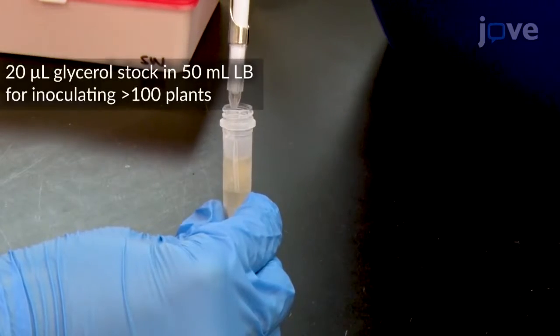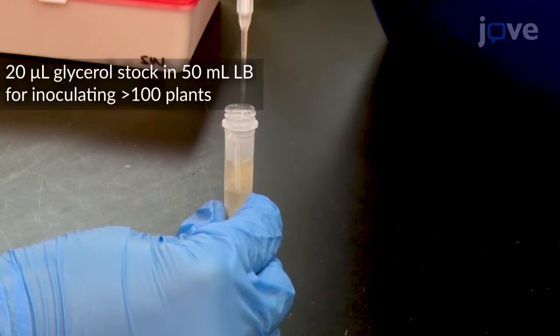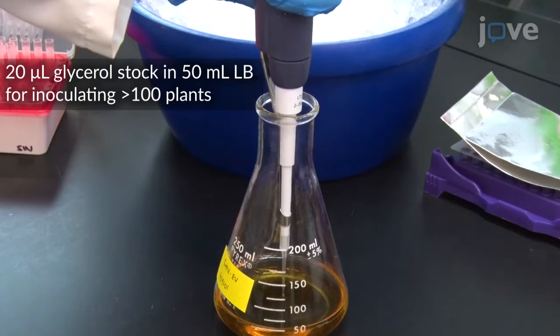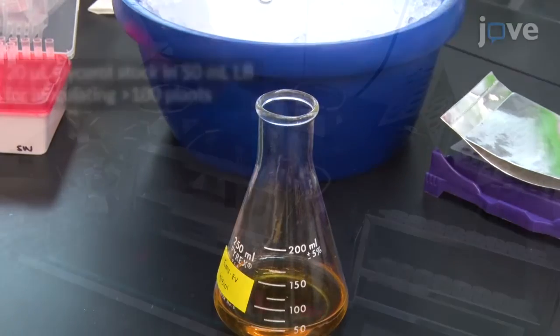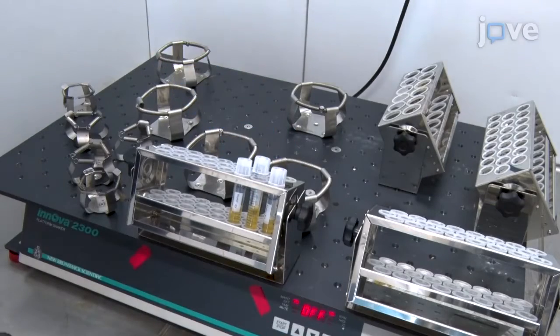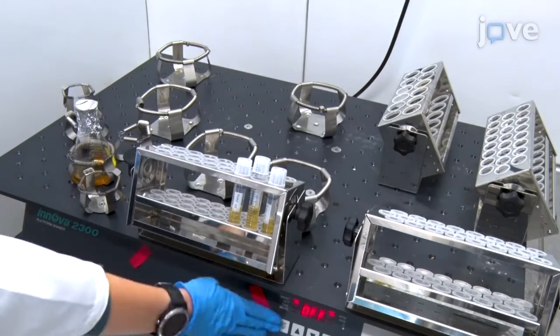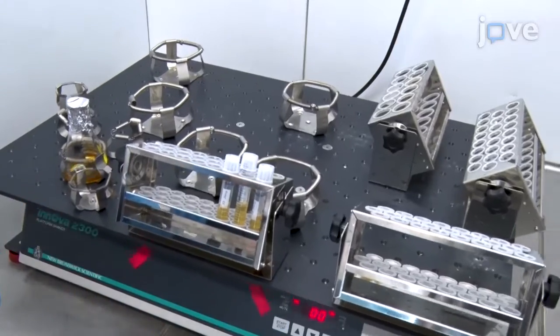Prepare agrobacterium for injection by inoculating the agrobacterium strain containing the desired viral construct in LB media with antibiotics. Then incubate the flask or tubes at 28 degrees Celsius while shaking at 225 RPM for 24 hours.